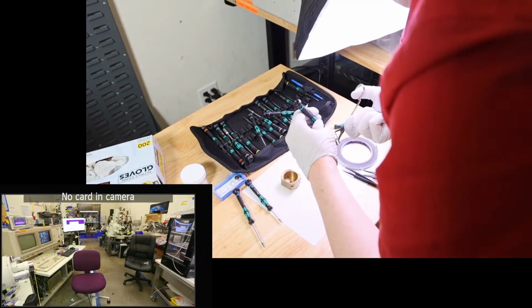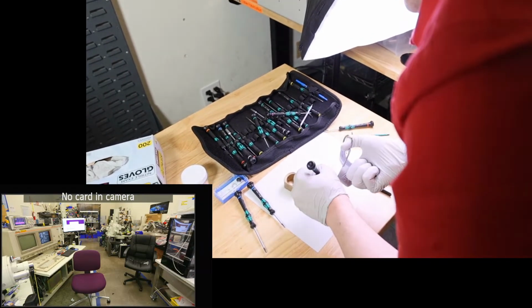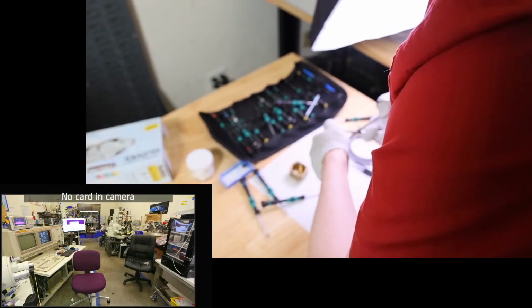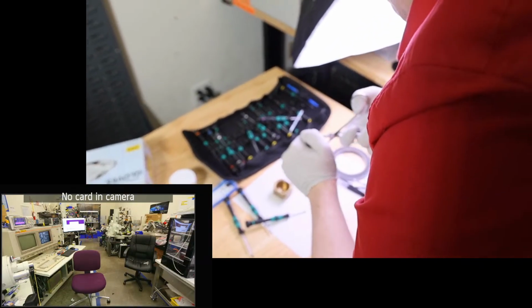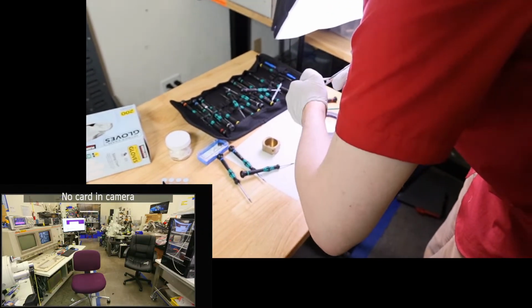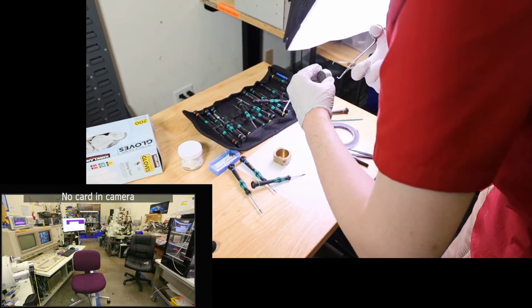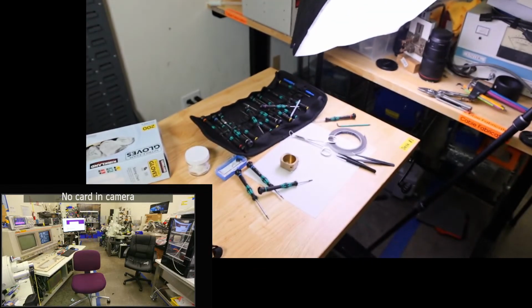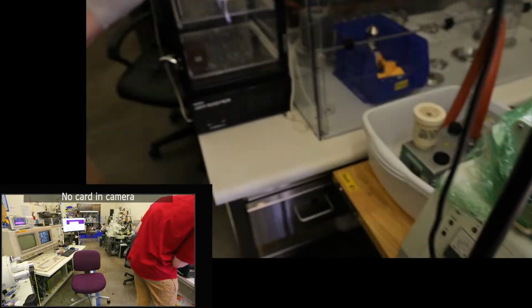Do we not have another sample holder available? We kind of do, but this one's particularly well suited for EDS at this particular height. So I would like to use it, but we will switch to our backup very shortly if this does not work out. Okay, that is certainly in there. So we're just gonna leave this in our desiccant cabinet for a bit, and we're gonna switch to a different holder.